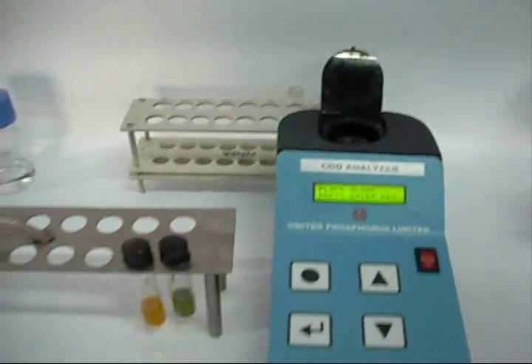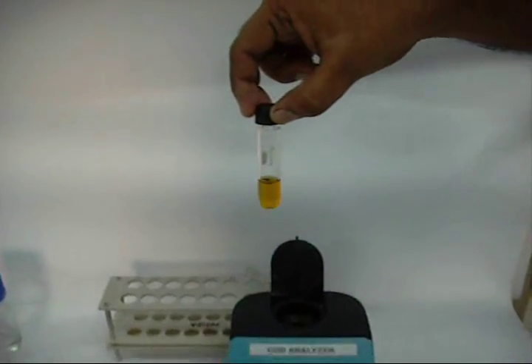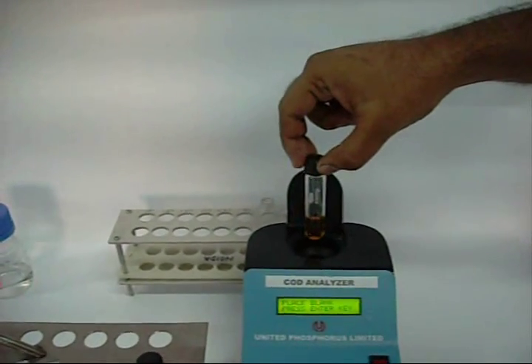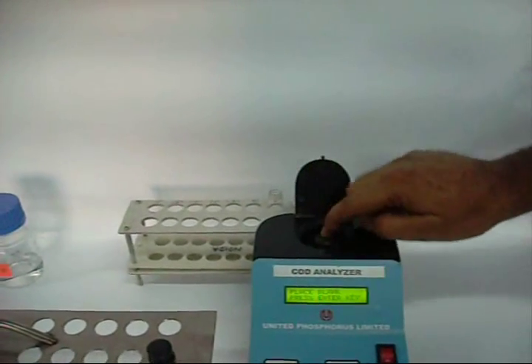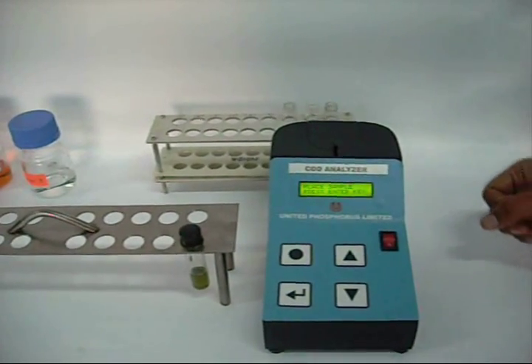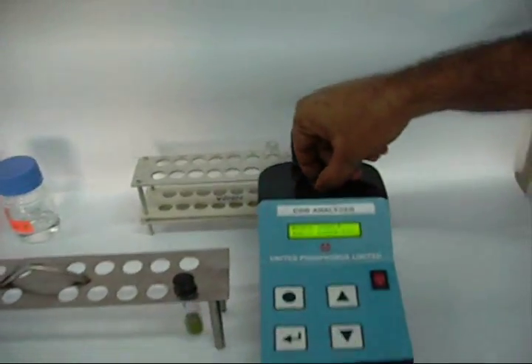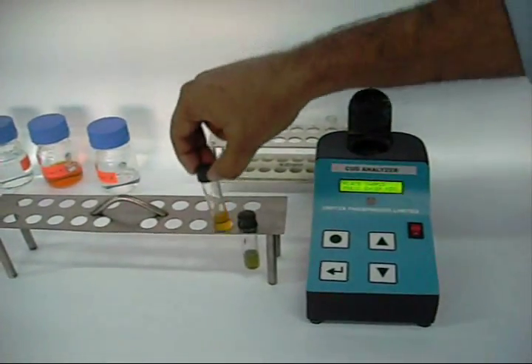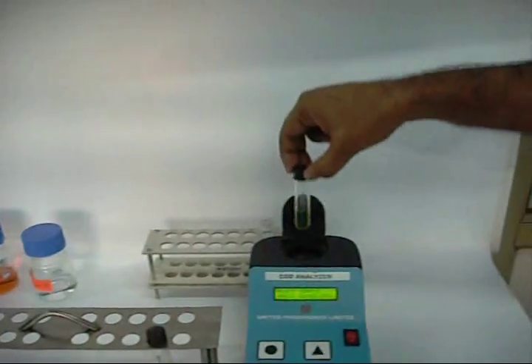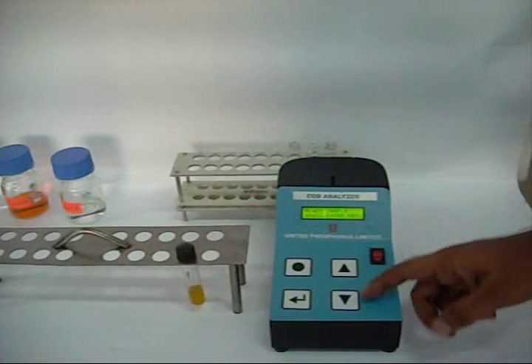Place the blank vial when the prompt appears and press the enter key. Remove the blank vial and place the sample vial as prompted, then press the enter key. The display shows the COD value of the sample directly.